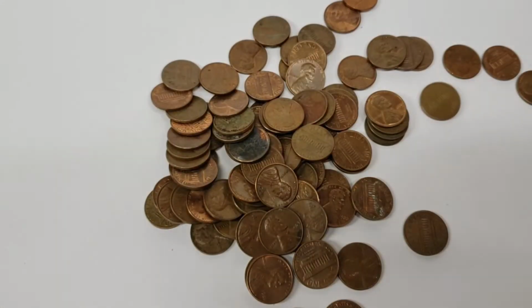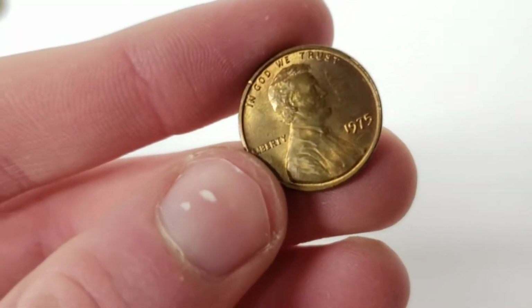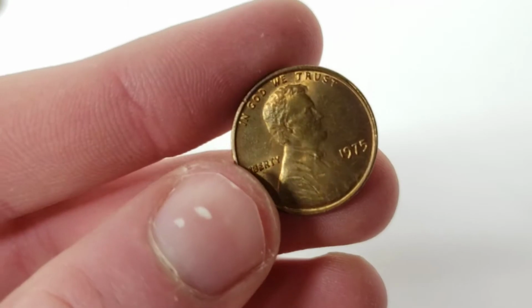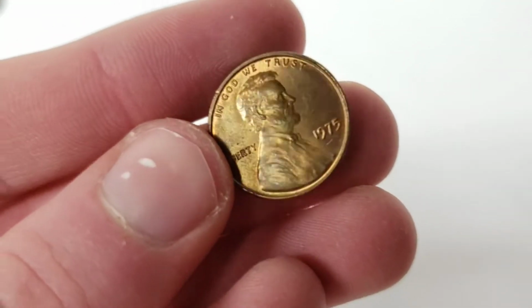But now you're probably wondering, where are you getting all the copper from? But you know what? I'm glad you asked. Pennies, obviously. In the US at least, older pennies are made with about 95% pure copper, which is good for our purposes. So check for any dates prior to 1982 and you got yourself a copper penny.